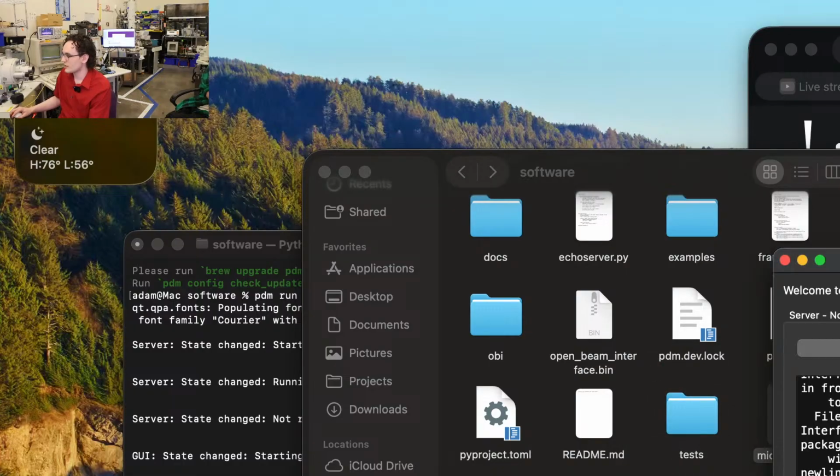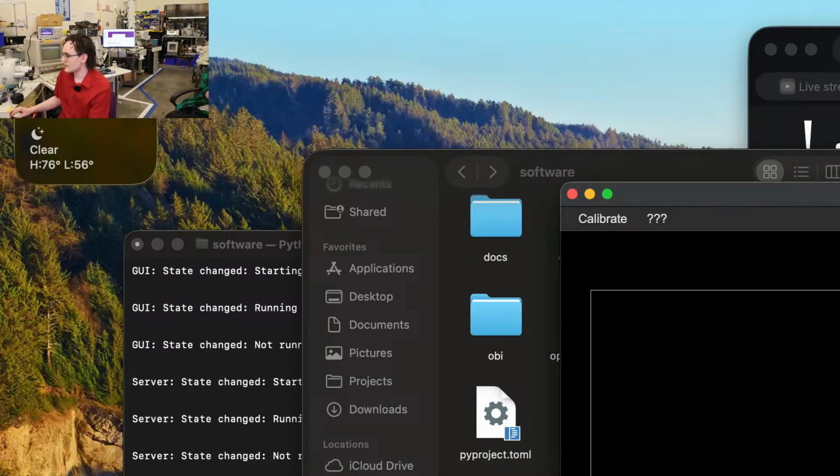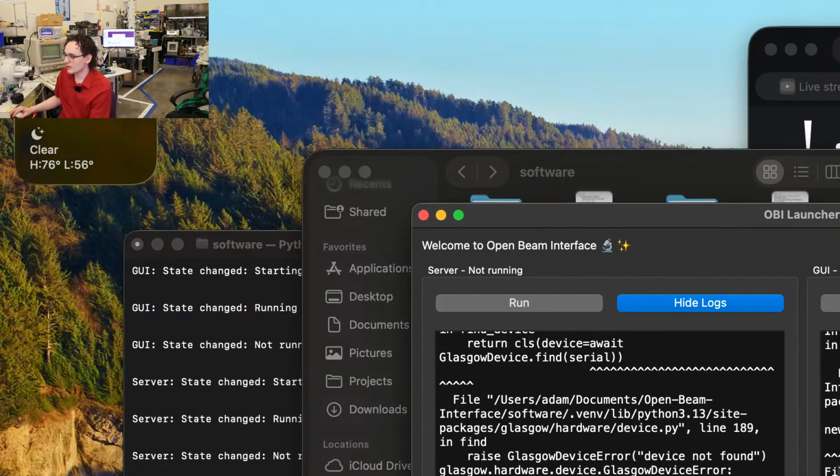So now we've got our toml. We can go ahead and run that again. And this time, okay, we've got our OpenBeam interface GUI. That's shown up. That's great. However, we are getting a Glasgow device not found error. And that is entirely expected because I'm holding it, and it's not plugged in via USB yet.